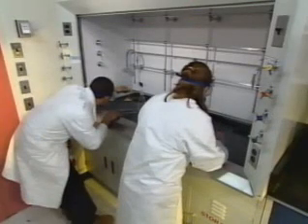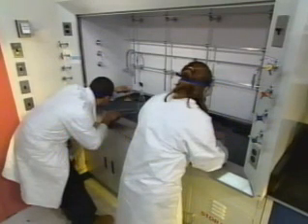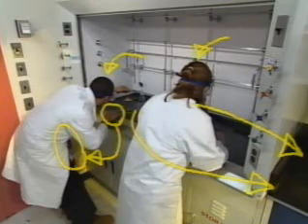Wow. Let's look at that again from another angle. The fire is going to be here. Here is the extinguisher over here. When the fire starts, this kid goes for the extinguisher, while this one clears the area. Then, boom, in comes the extinguisher, and the fire is out. Now let it run. Fire.